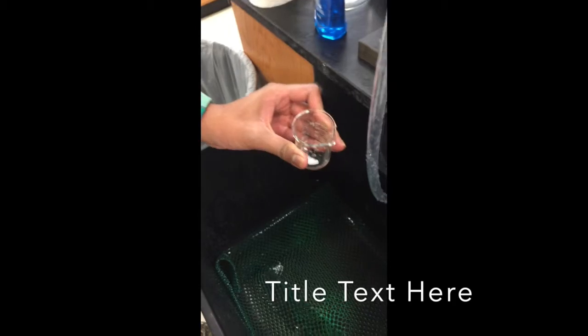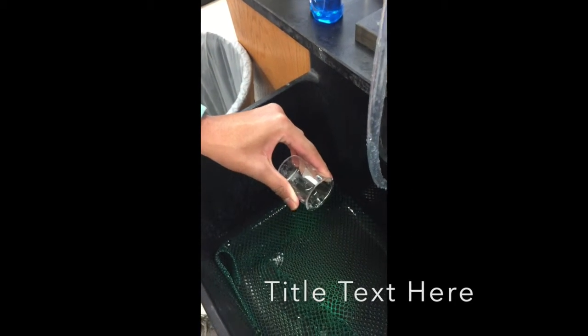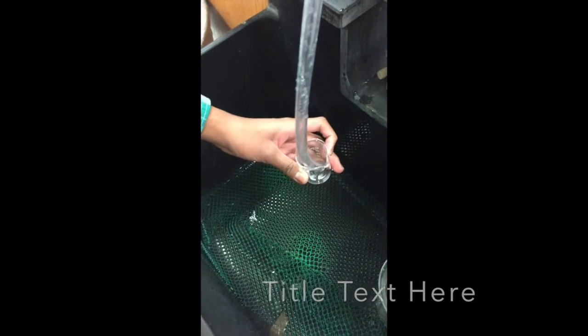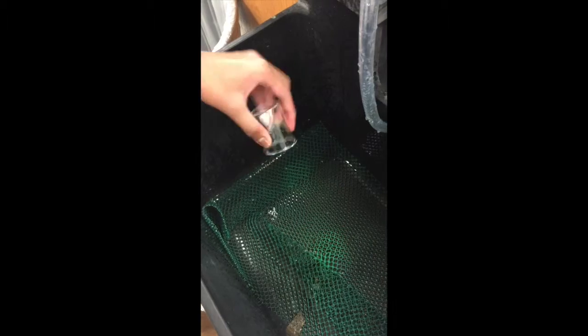The extra chemicals were disposed of in the chemical waste containers. We dumped all the water with the dissolved substance down the drain, and we put the crucibles and beakers back in the right spot in our numbered group basket. The faucet hose was used in order to effectively rinse all of the materials and make sure that they were cleaning out substances.